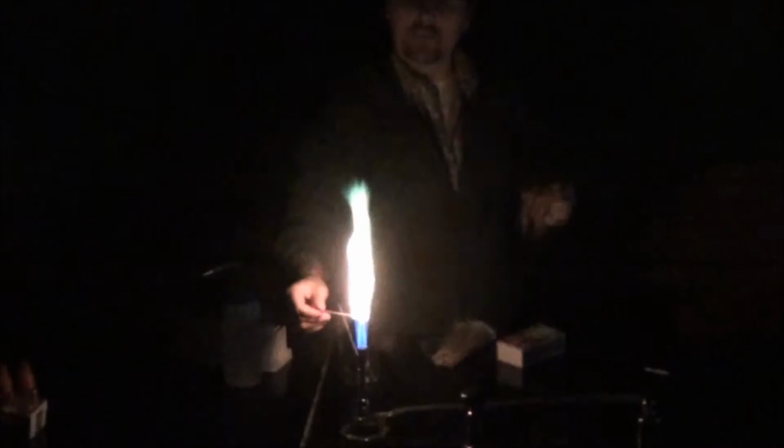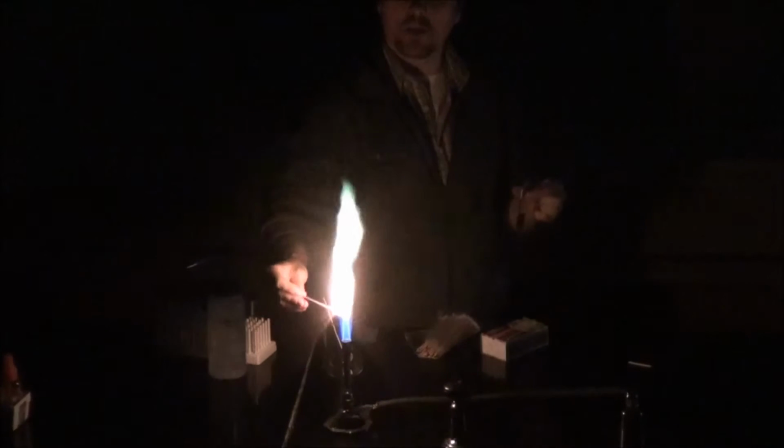I believe this is a copper ion. Okay, it's definitely wet. It should do its trick. There we go. So we see the metal ions, when we put the energy into them and they get excited, release the light that you see. In different metals, the electrons are in different energy positions. Because of the way the electrons get excited and decay back down, they produce different wavelengths of light. This one is sodium.